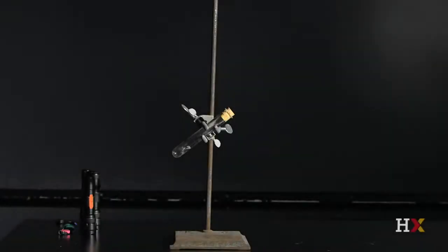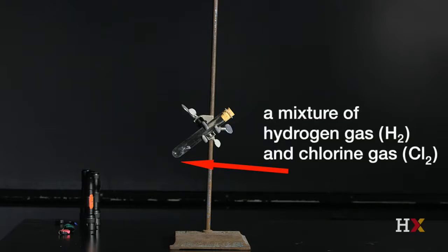In a dark room, there is a small corked quartz test tube held in a 3-jaw clamp on a stand. The test tube contains a mixture of hydrogen gas, H2, and chlorine gas, Cl2.